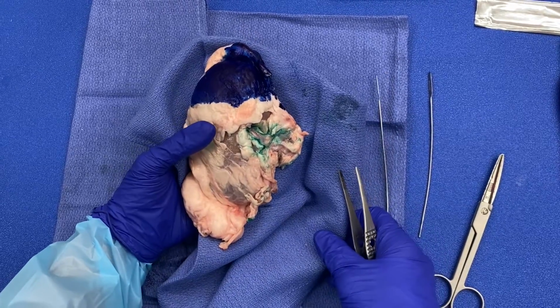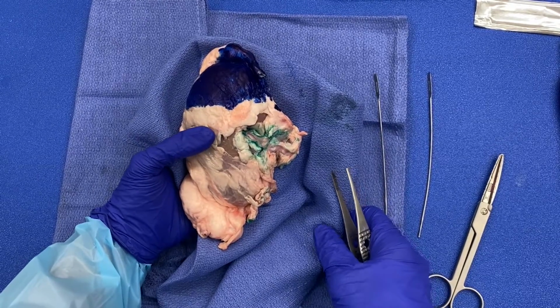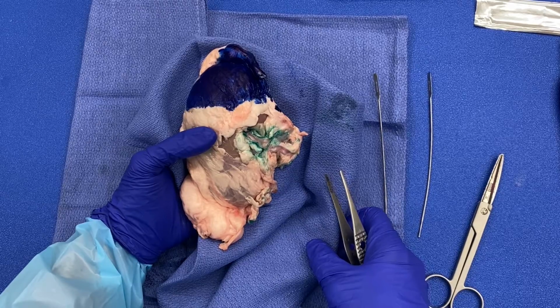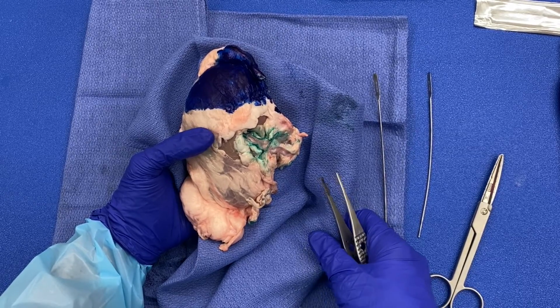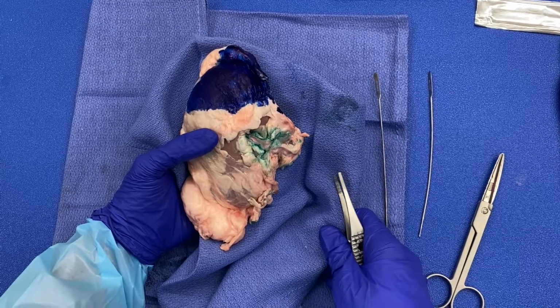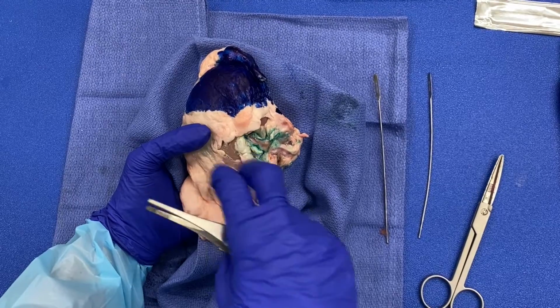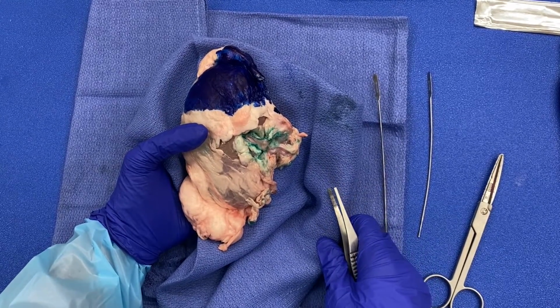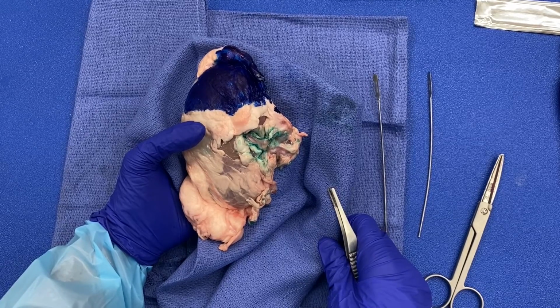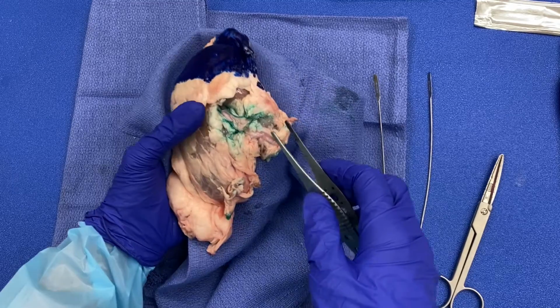Another thing that you will do upon receiving a nephrectomy specimen is palpate the specimen to determine where the mass is. This also should have been noted when reviewing the imaging. So I am saying that there was a mass in the superior pole, which is a common area for renal cell carcinomas to be found. I have then inked the Gerota's fascia over the palpated mass, and I've also inked my hilar structures.